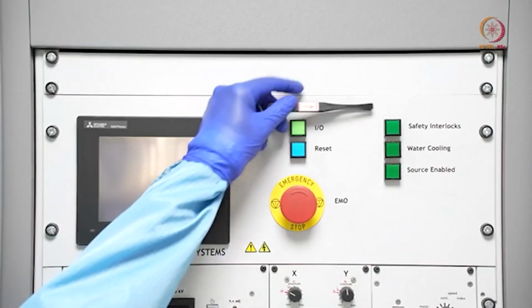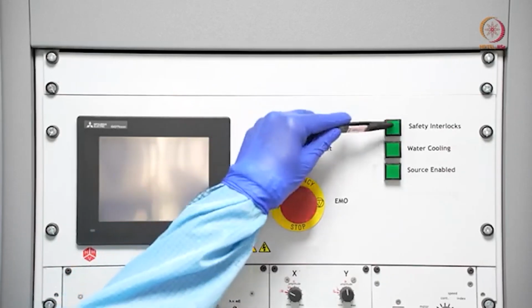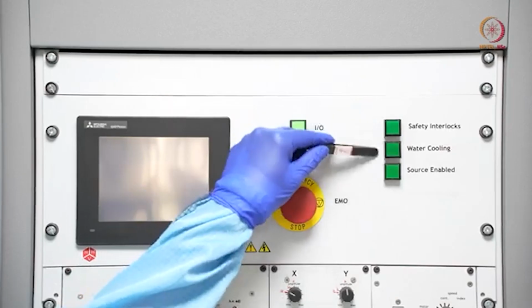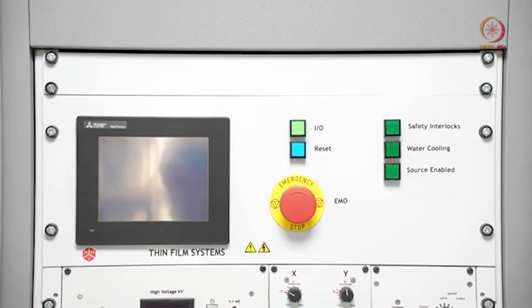You can just reset it and then start the tool. And here, if you see the next, these three are the indicators. These are not press switches, you can see here, we cannot press them. Basically these are indicators. The first one, as you can see, is safety interlock. Safety interlock means whether the tool is safe for the user to go for the high power operations. As we have shown already, there is a 5 kilovolt transformer, so we cannot directly switch it on without covering the area, or without ensuring that we will not be in touch with that transformer.